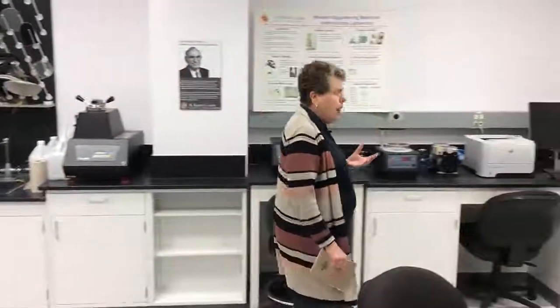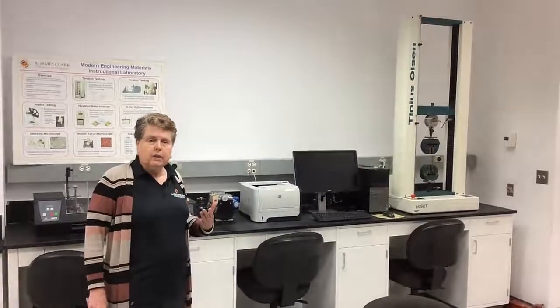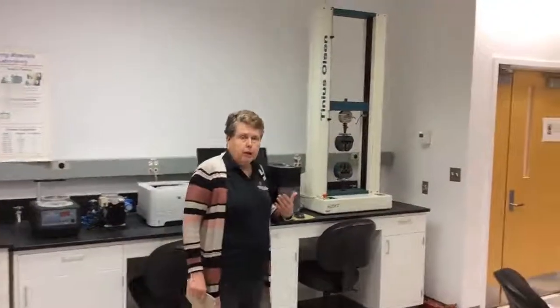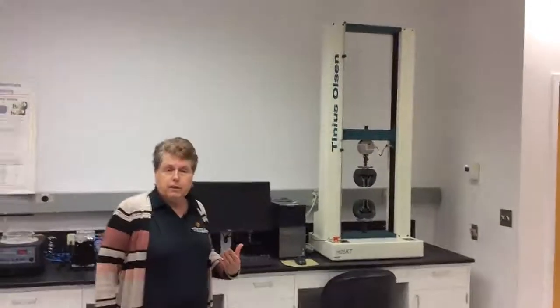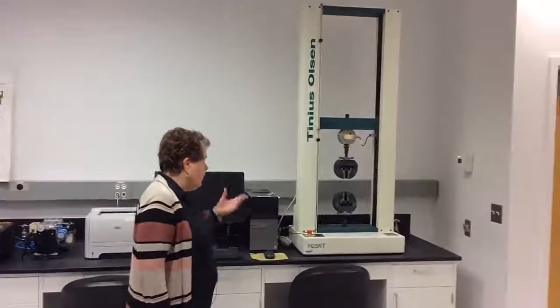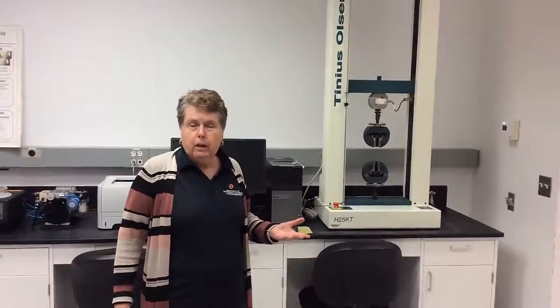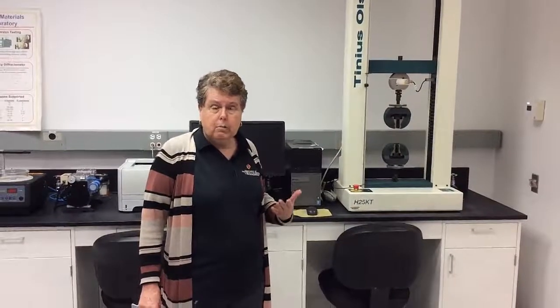We also use this lab when we do our mechanical properties class. It's important to understand the different kinds of mechanical properties in metals, ceramics, and polymers, and to understand how those properties are affected by structure at different levels. Here we have a mechanical testing frame. It's currently set up to use what we call a dog bone specimen, which, think of your typical milk bone dog biscuit, and we can evaluate the strength of materials.